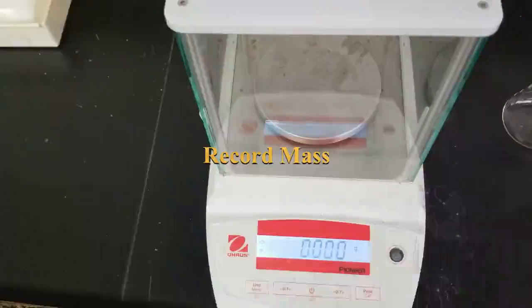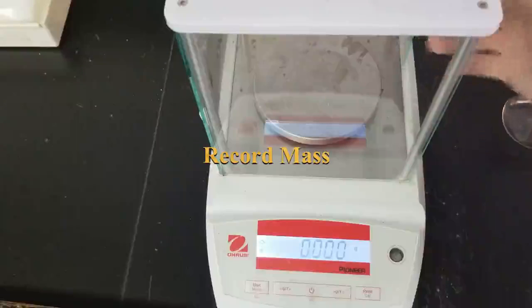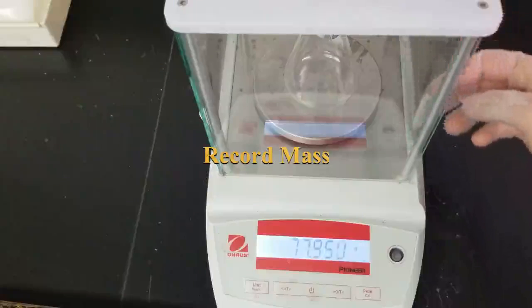All right, so our Erlenmeyer's cooled down. Want to go ahead and weigh it. You see it's already tared, nice and zero. Let's go ahead and weigh it.